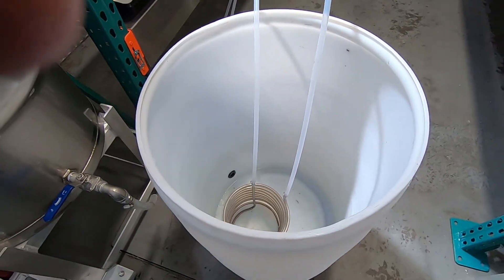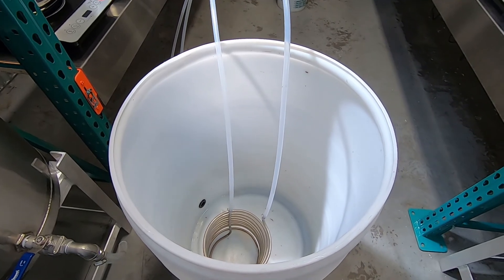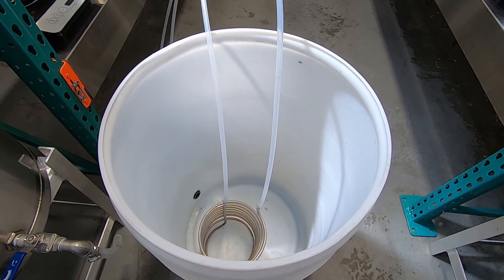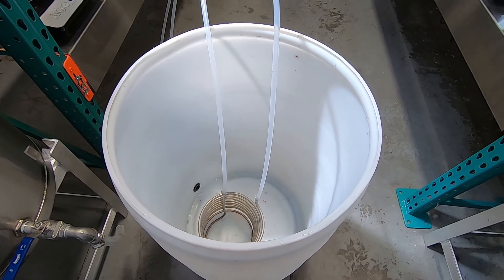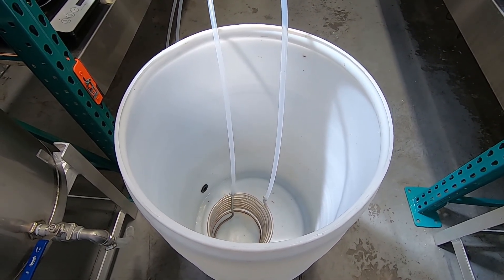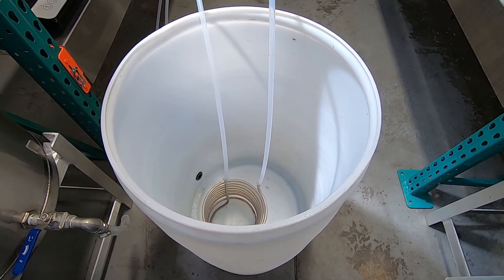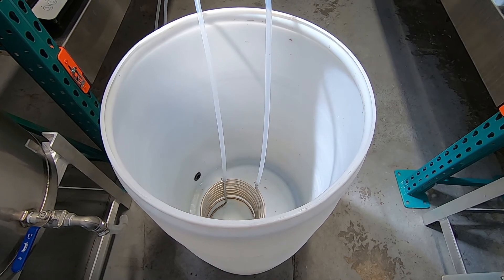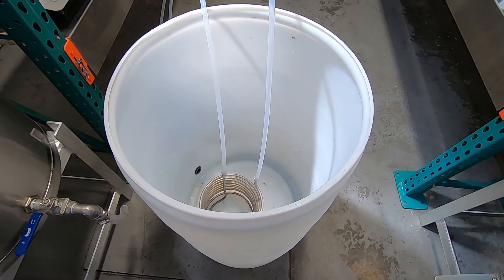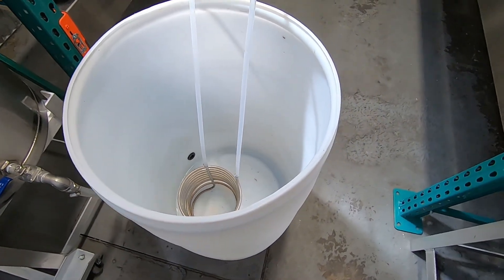Basically you just fill this up with water. Water is an amazing heat sink, so you don't need any type of ice or anything in here. If you're starting at ambient temperature — let's say ambient being 70 degrees Fahrenheit — typically you could run eight hours straight on 70-degree water without it overheating to the point where it won't condense anymore.